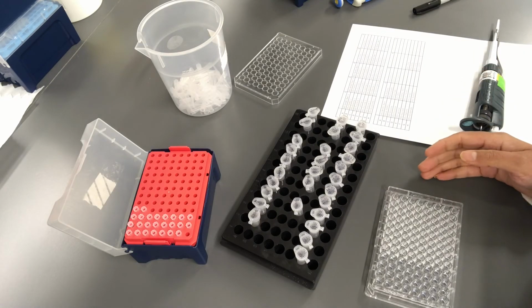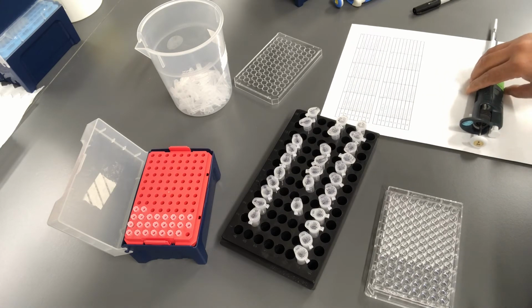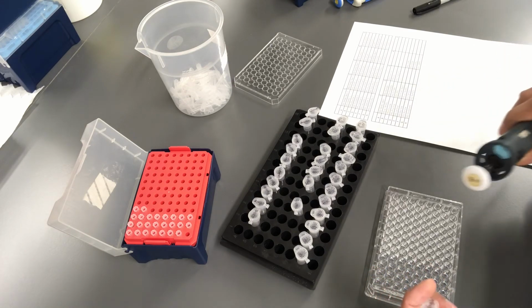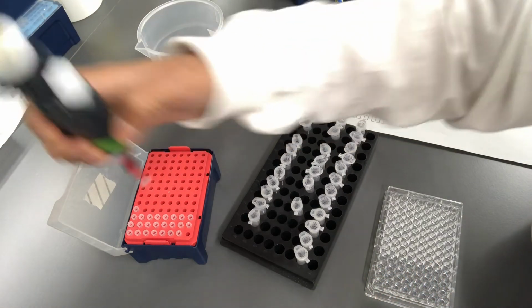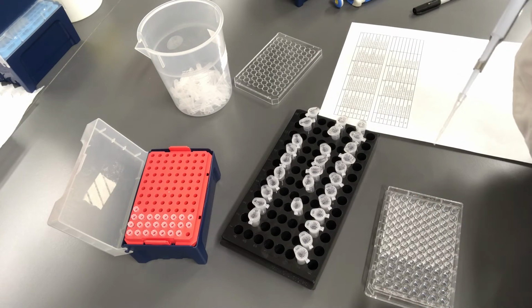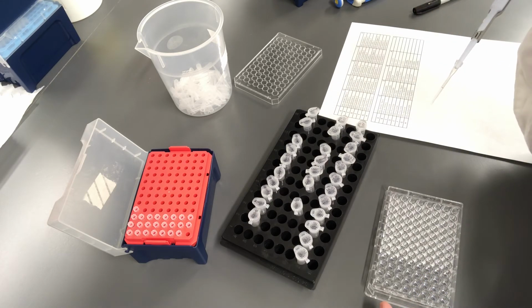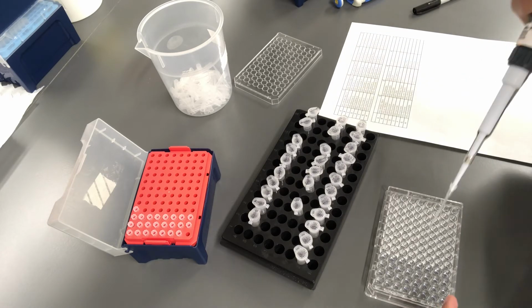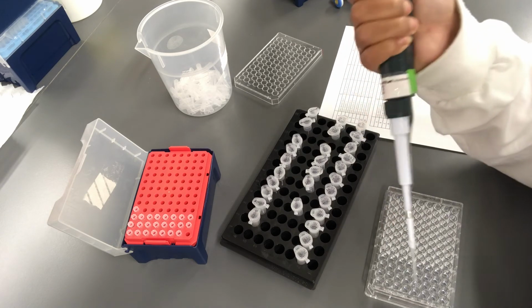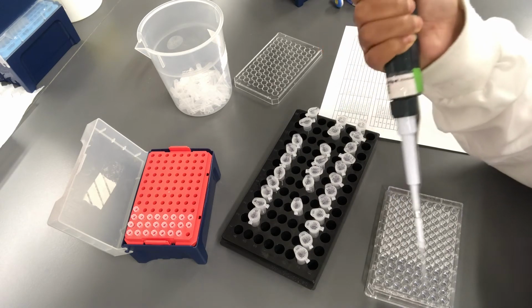So I'm done pipetting all the media into 96 well plates in 4 columns. Now I'm going to pipette Ralstonia cultures that I have in a microfuge tube, and I'm going to pipette 15 microliters of that into all the wells except the wells that shouldn't contain bacterium, and those are 1A, 2E, and 3D over here. So I'm starting with the second well, and adding the culture into all of the wells except the control without bacteria.